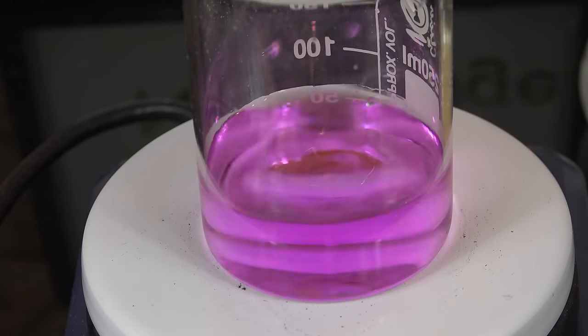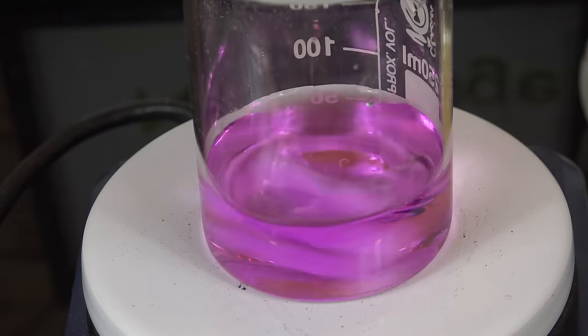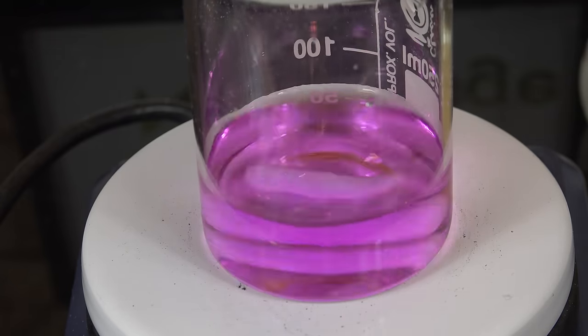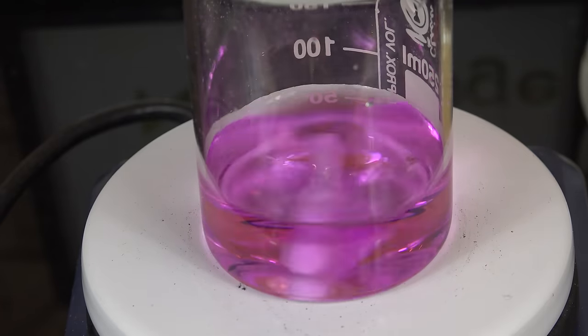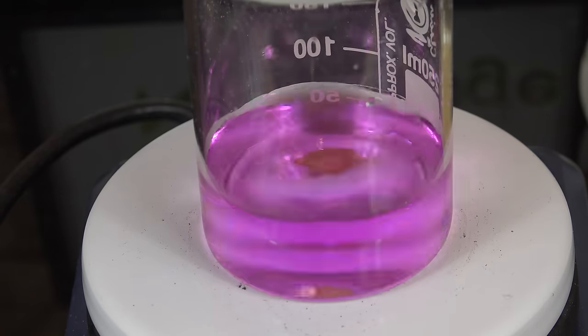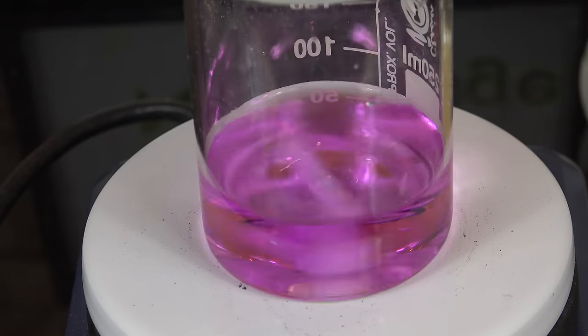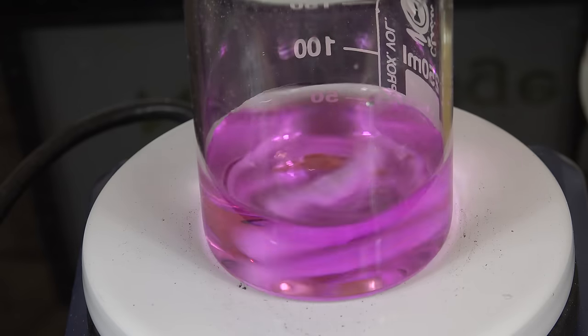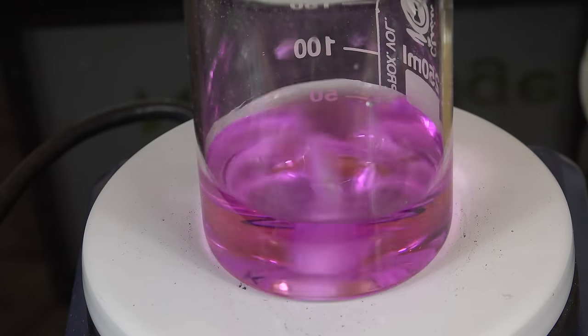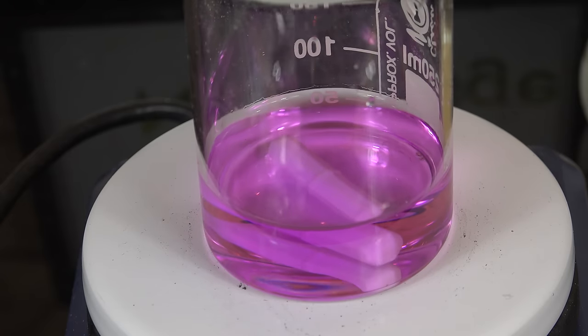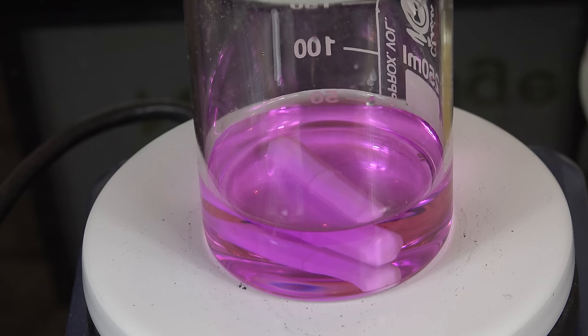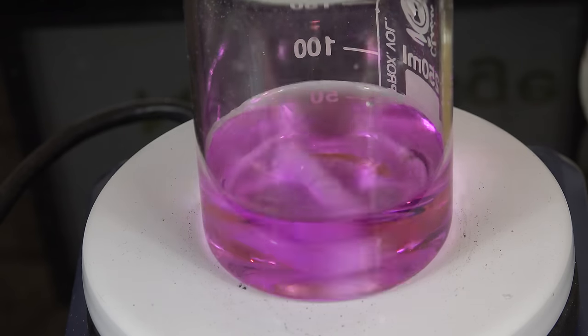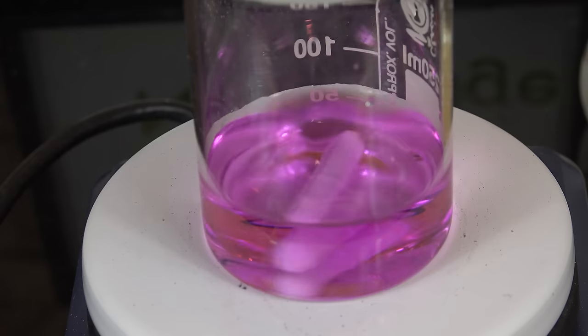What we're doing is testing if the supporting titration mixture of sodium bisulfate has any reductive impurities. If it did, for example if it had sulfide contamination, it would go clear as it reacts. If that happens then your source of sodium bisulfate is contaminated and you should cancel the experiment and find another source. Fortunately for us, my source seems good so we can continue. I tried this earlier with drain cleaner grade sulfuric acid but the test failed. So that's why I switched over to sodium bisulfate.